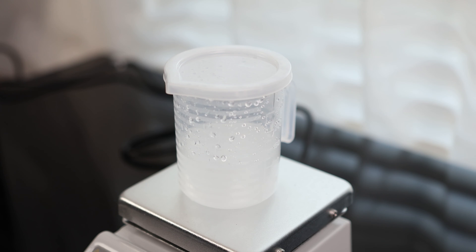The idea is we just want to stir this until we can see the crystals in the salt. Then we're going to leave this thing capped and leave it there for about a day to let it set, and that will make our calibration solution.